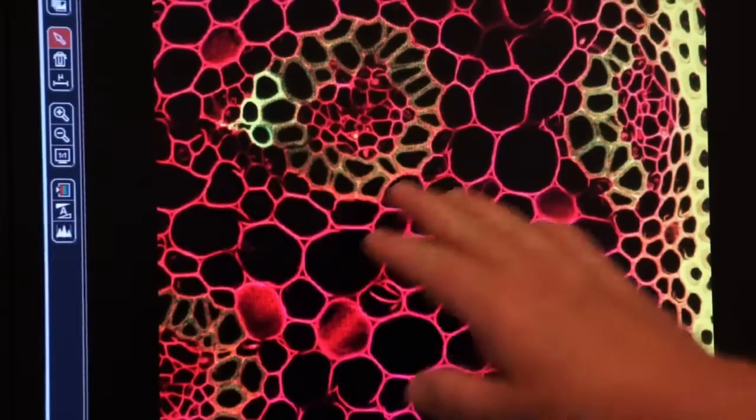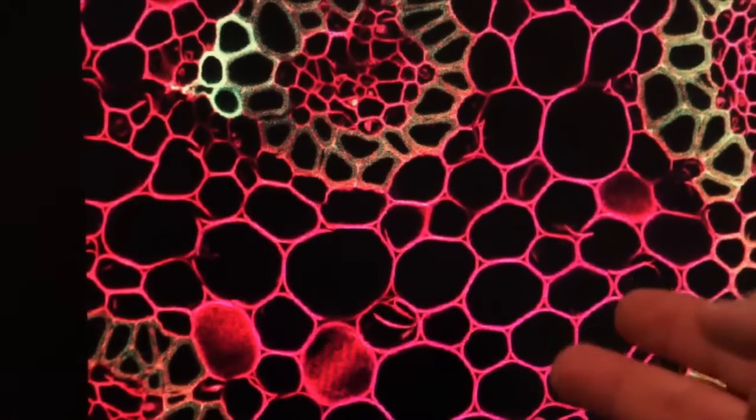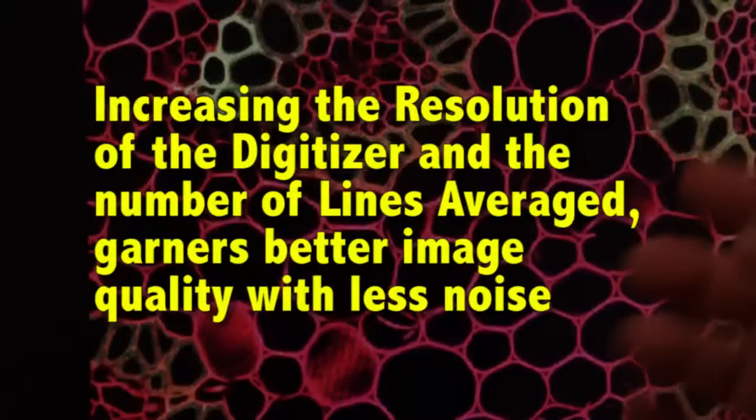Notice that the image is a lot cleaner. It's less noisy. So if we look on our composite image, you see now a lot of that pixelation has gone away. So by increasing the resolution of our digitizer and increasing the line averaging, we get a cleaner image. Let's try that with frame averaging.